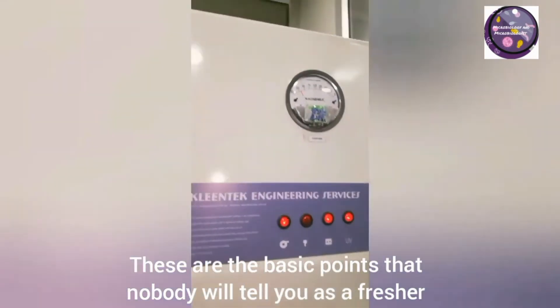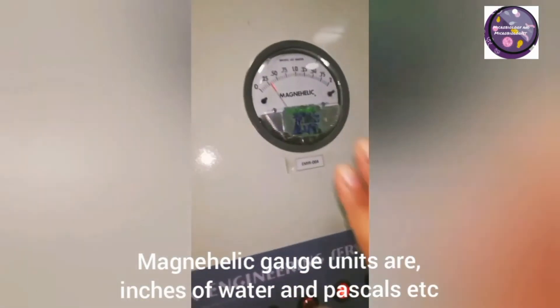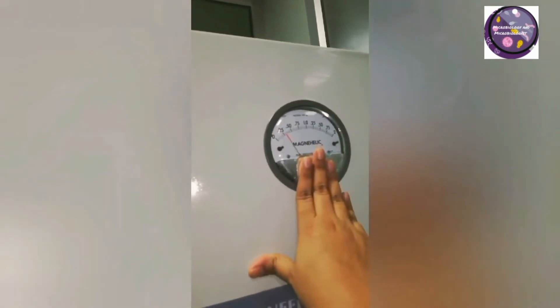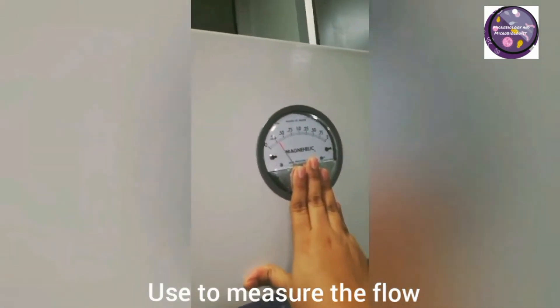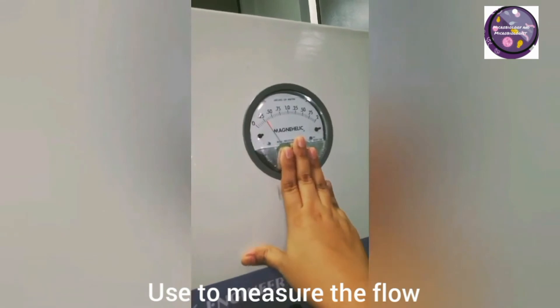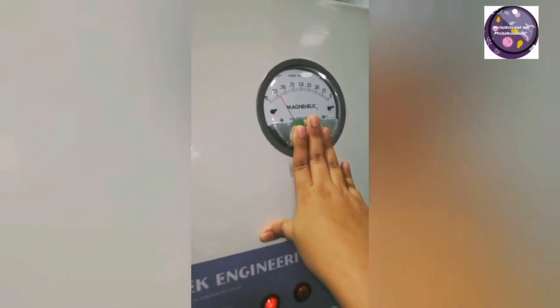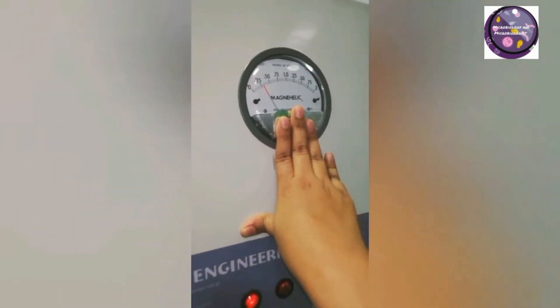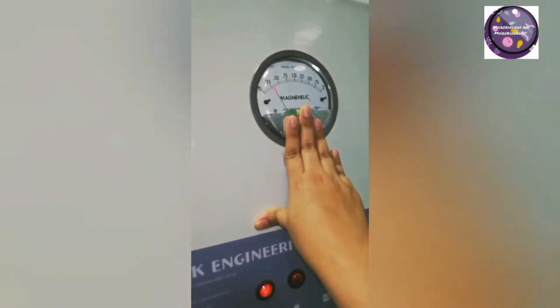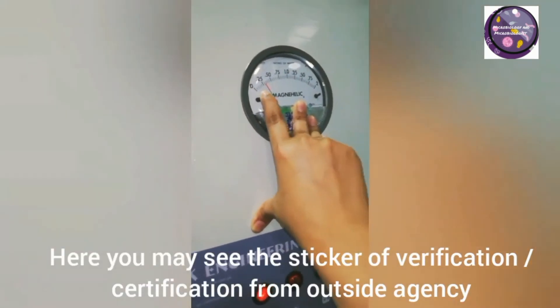Here is a manometer, which measures in units of inches of water. It can also measure in Pascal units. Here it shows 0.27, which is within the limit. It is calibrated from an outside source annually, along with the certification.